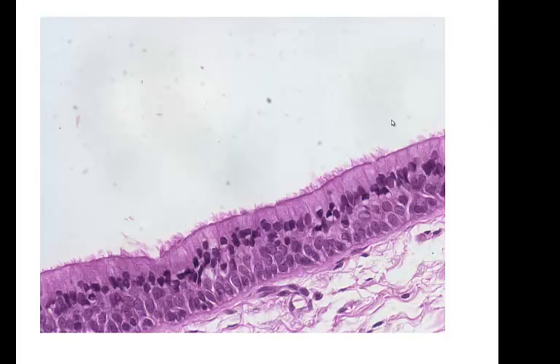And can you see it there? Here it is. Now, because this is in a respiratory passage which opens up to the outside, this makes this type of epithelium a mucous membrane. If you have this plus the underlying connective tissue, that defines a mucous membrane. Epithelium plus underlying connective tissue is a mucous membrane.